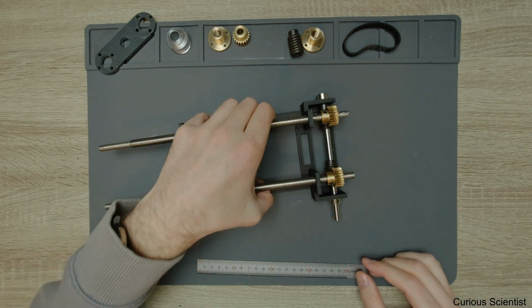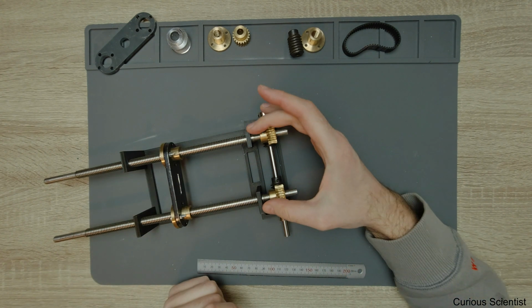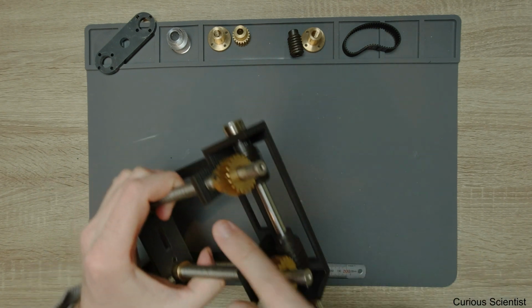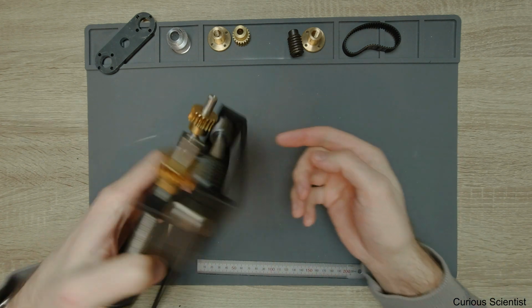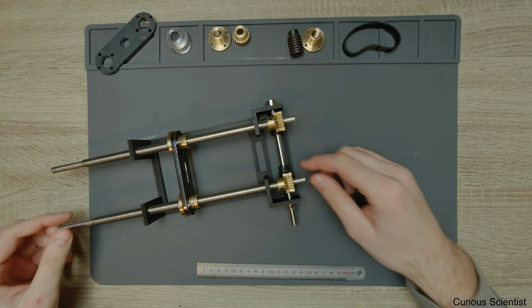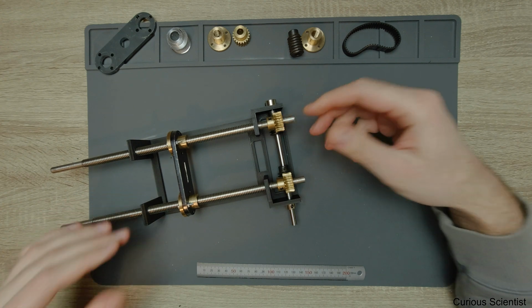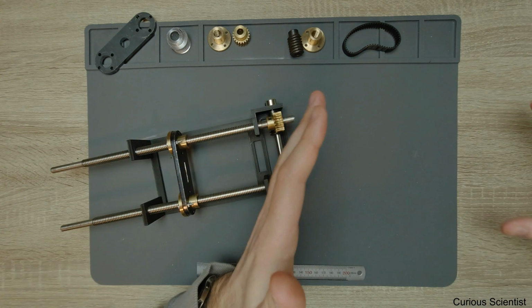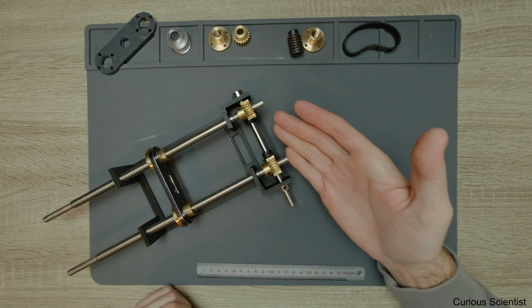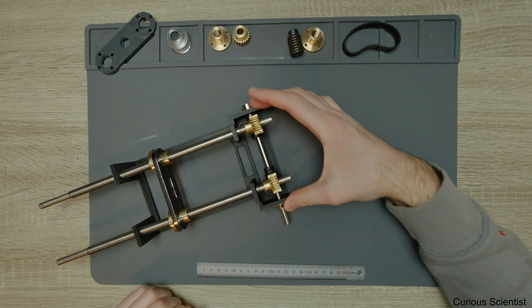But what I want to show you, so we will have this kind of cage here where we will put radial and axial bearings in these holes here and there, and also here and there, so we will be able to hold the lead screw and we will be able to hinder it against moving in this direction, so in horizontal direction. So this is like, let's say, the front part of the tensile testing machine.